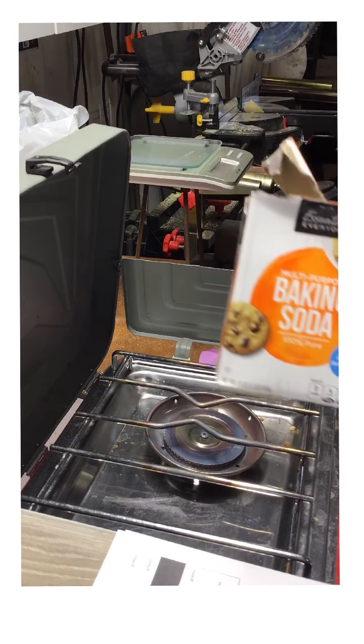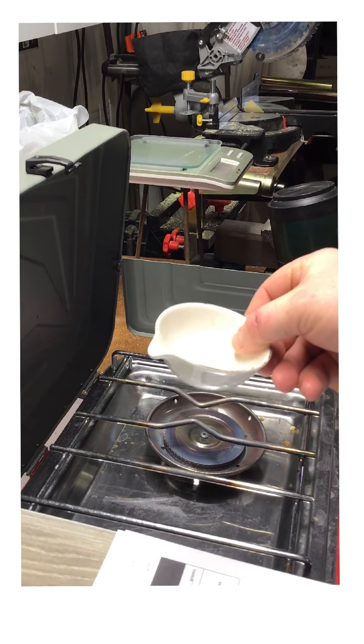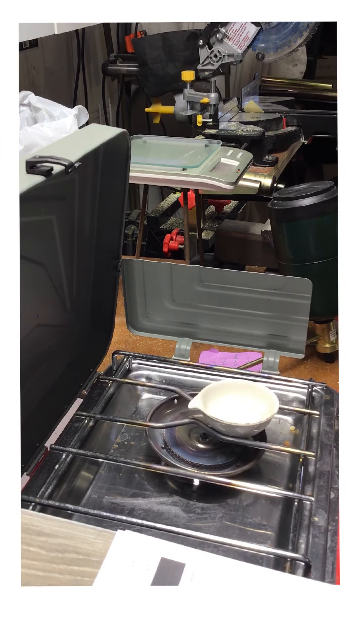how much did we start with? How much did we end with? And using stoichiometry, we can figure out the identity of what the product is at the very end. So what I'm going to be doing is I'm going to take the mass of this first. Then I'm going to put some baking soda in and retake the mass of it. Then I'm going to heat it up until it stops the reaction. And then I'm going to reweigh it, and you're going to find your final mass.